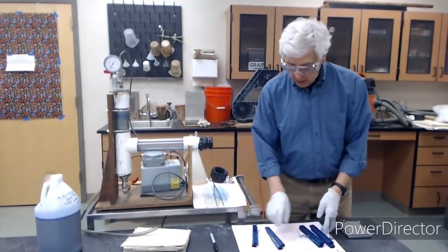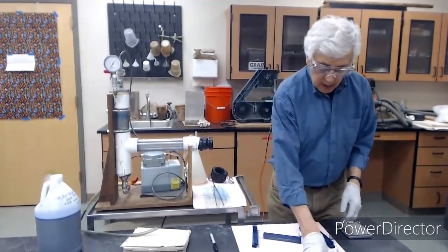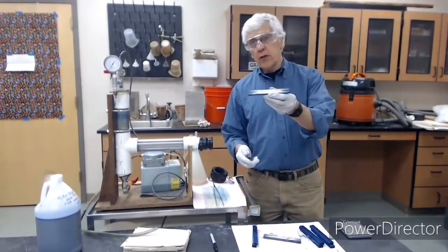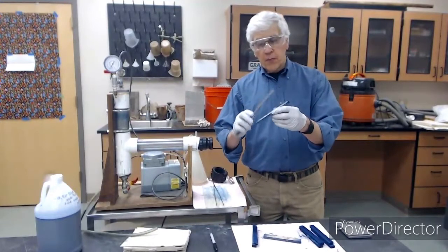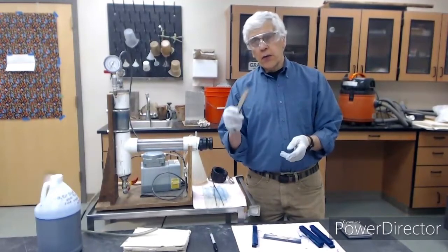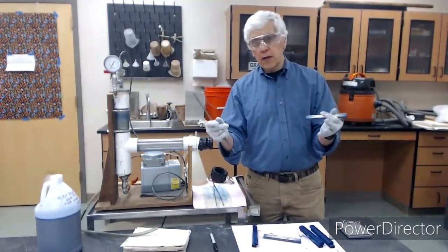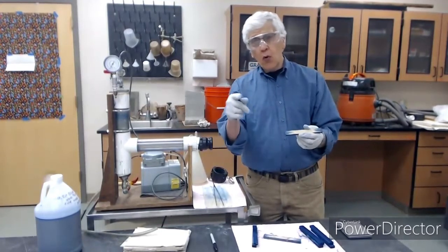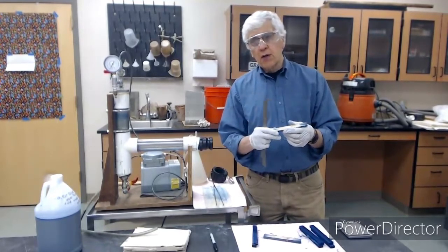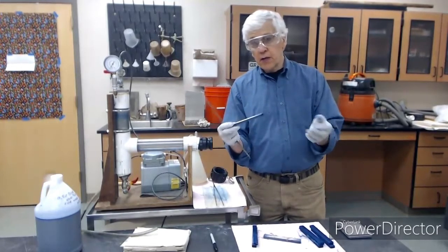So now we must deal with the Douglas fir. This is Douglas fir number 1. I will just use the ruler. There's no way to do this accurately. Now, you recall, when they do this commercially, they would have a larger piece of lumber, like a 2x4 at least, and they would bore into it. They would extract the boring and then test that for penetration. So at least for that boring, they can be accurate, right? Because it's only 1/4 of an inch.